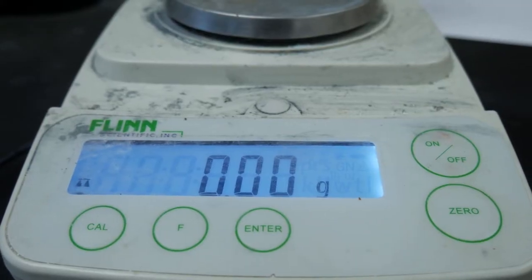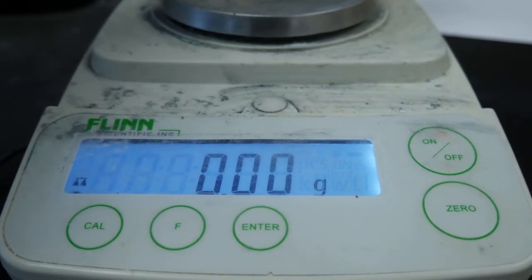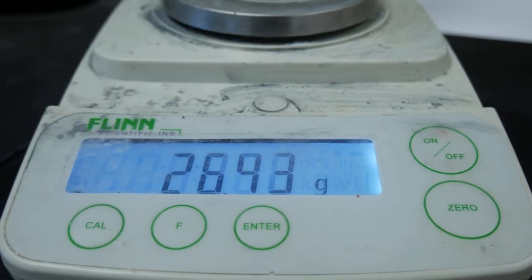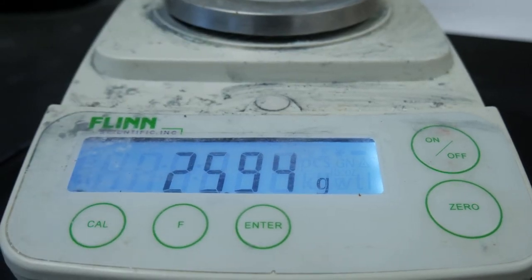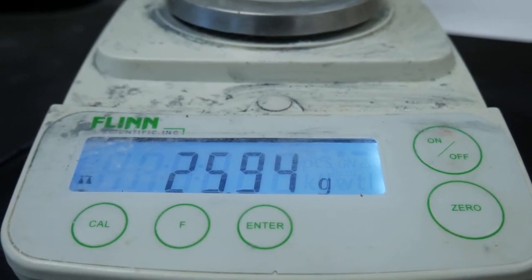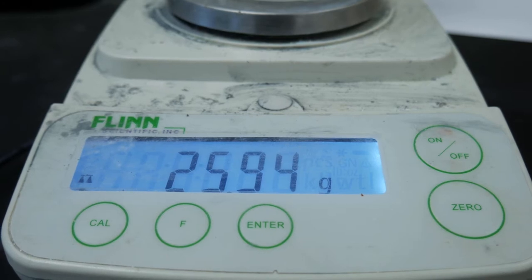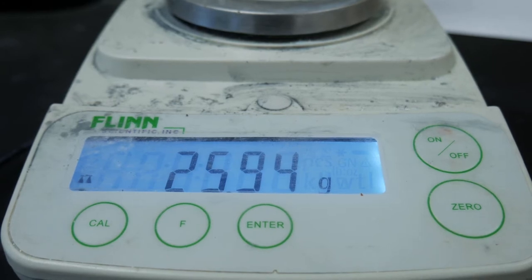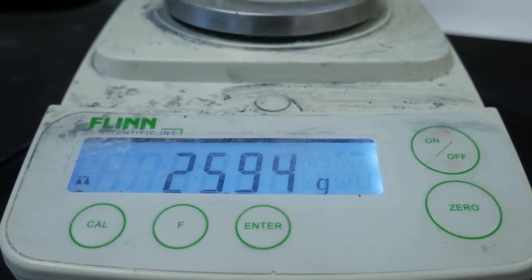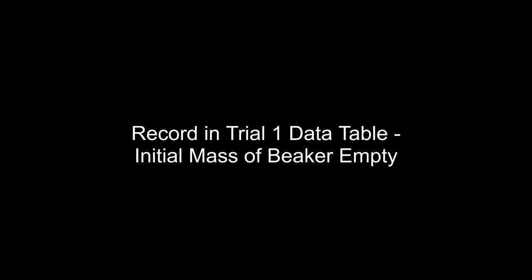For the first part, we are going to measure and record the mass of the beaker empty. We'll place it on our scale and we see that the scale says 25.94 grams. Please record that in the mass of the beaker empty column of your data table.